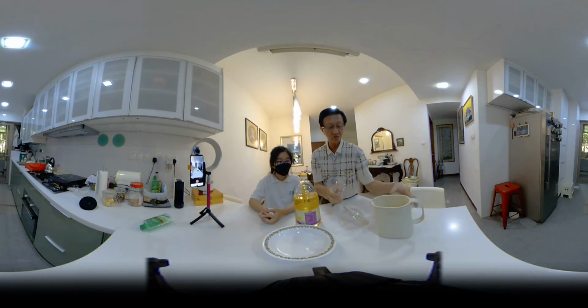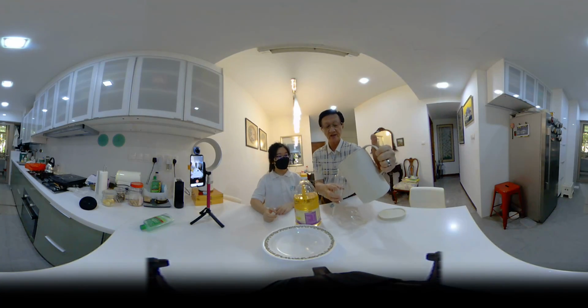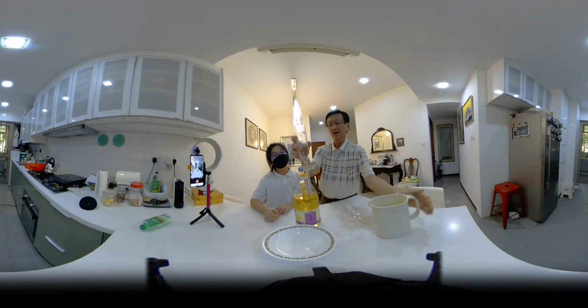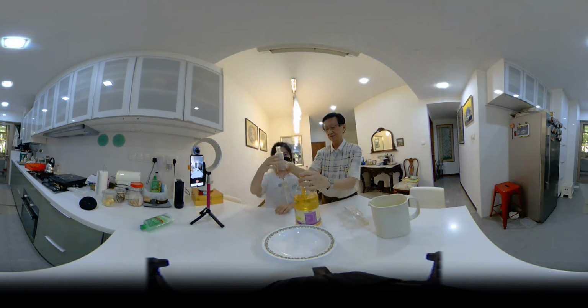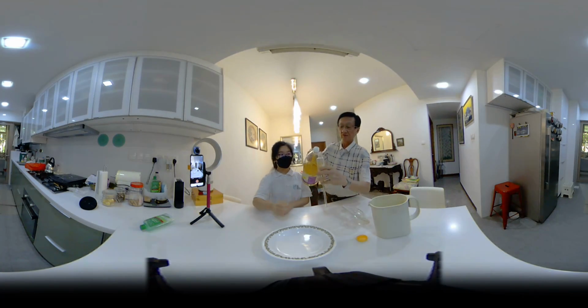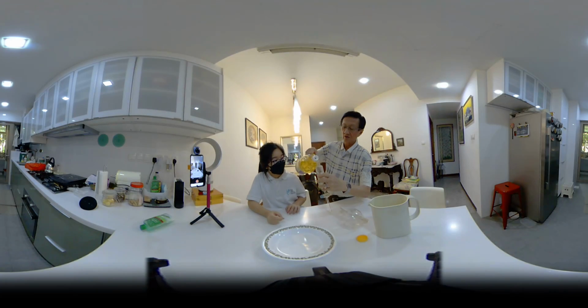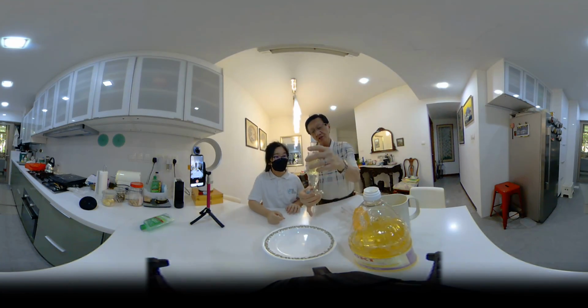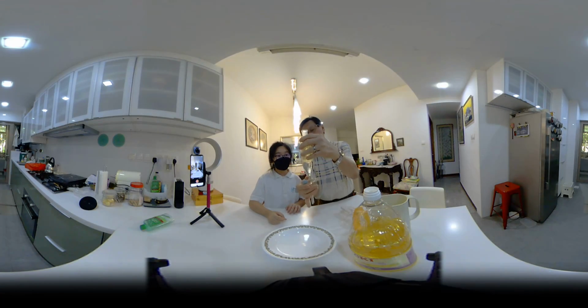So if I add in water, can you see? And if I add in some oil, you will find that they cannot mix. Okay? So what we'll do is, we don't want to shake it too much.